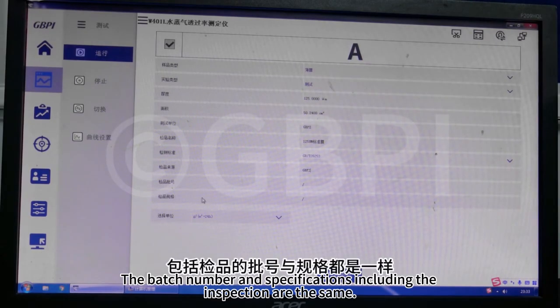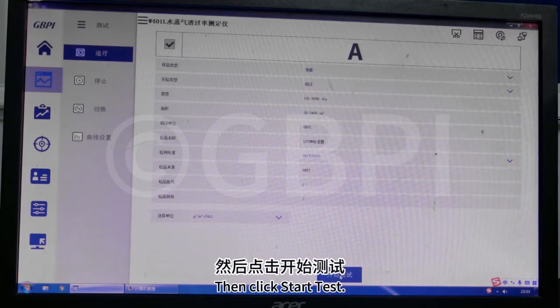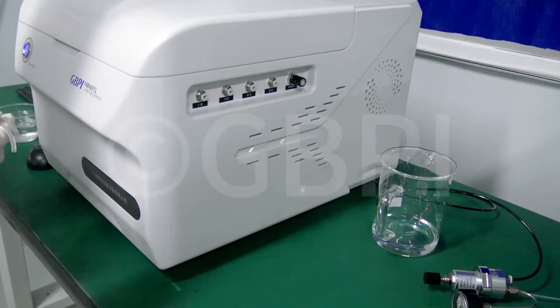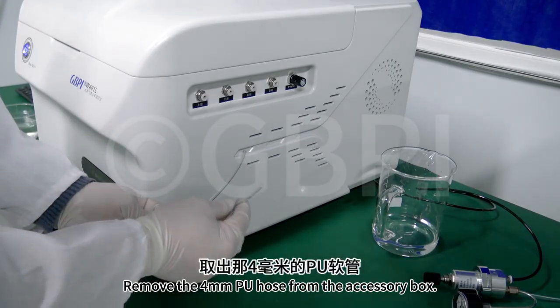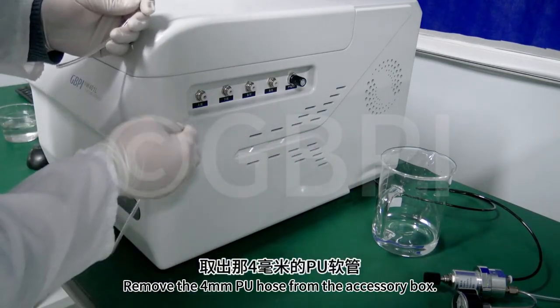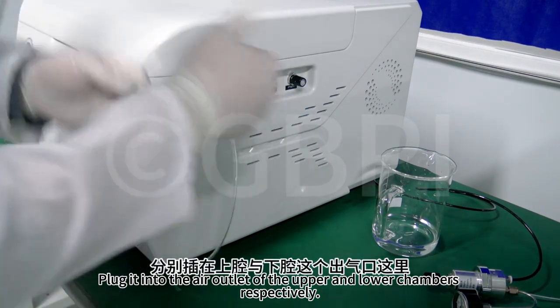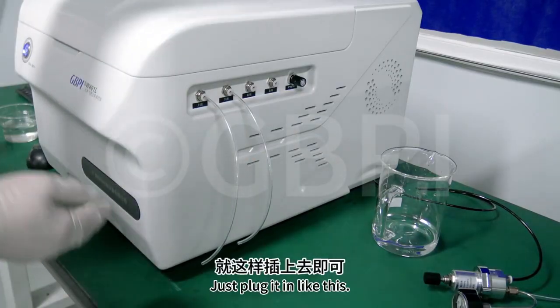The batch number and specifications including the inspection are the same. Fill in according to the information of the sample. Then click Start Test. Remove the 4mm PU hose from the accessory box. Plug it into the air outlet of the upper and lower chambers respectively. Just plug it in like this.